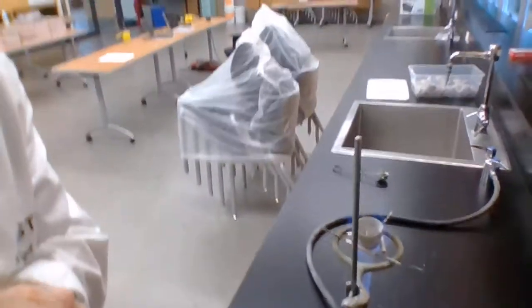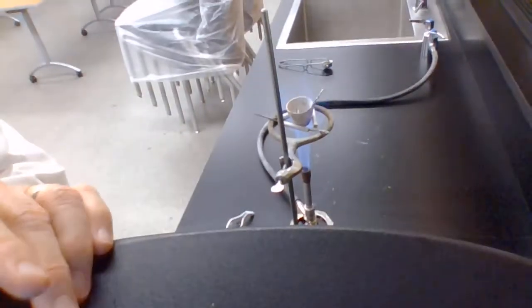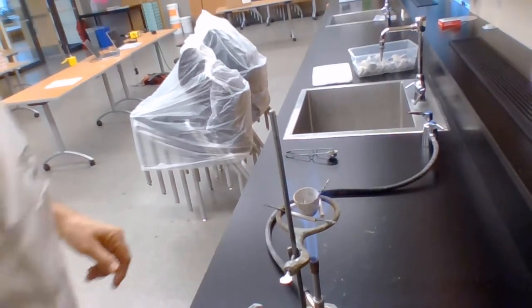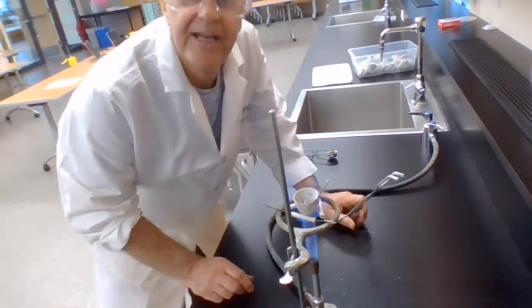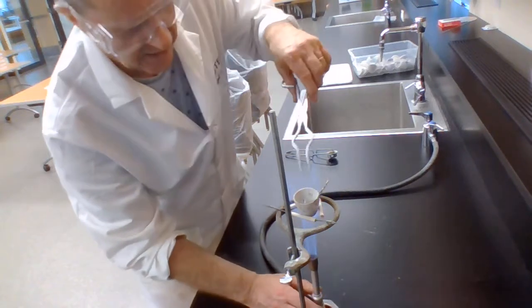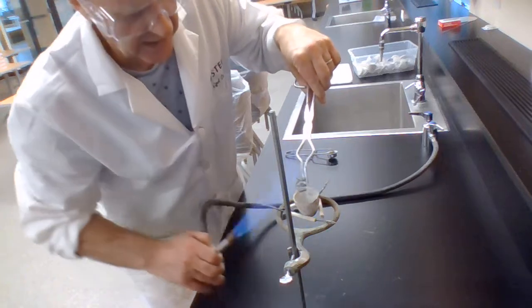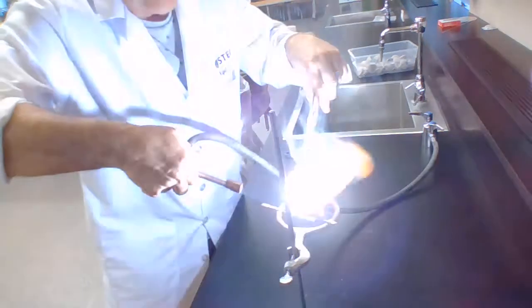But I don't have time for that. So instead of that, I'm going to do a cheat. And this cheat is involved in exposing the magnesium directly to the flame. Now I should hold the magnesium directly above the crucible so I don't lose any of the stuff. And the stuff, I'm sure you've worked out what it is.